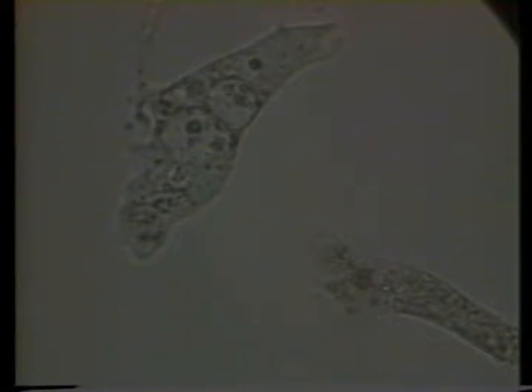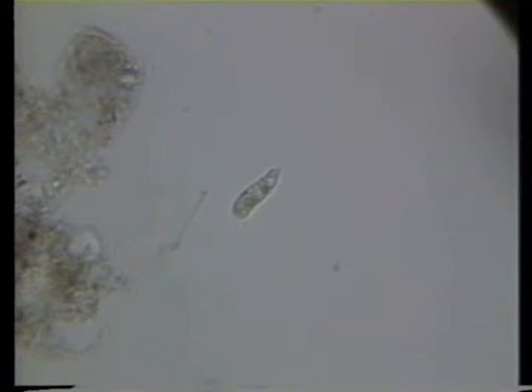Amoebas, the most primitive of the protozoans, are single-celled and ingest food by absorption. Mobility is attained by the movement of protoplasm within their bodies. Amoebas are usually predominant in the early startup stages of the activated sludge process, or when the process is recovering from an upset. Flagellates are round or egg-shaped in nature and are propelled by a whip-like tail called the flagella. They move either in a straight path or a corkscrew pattern.